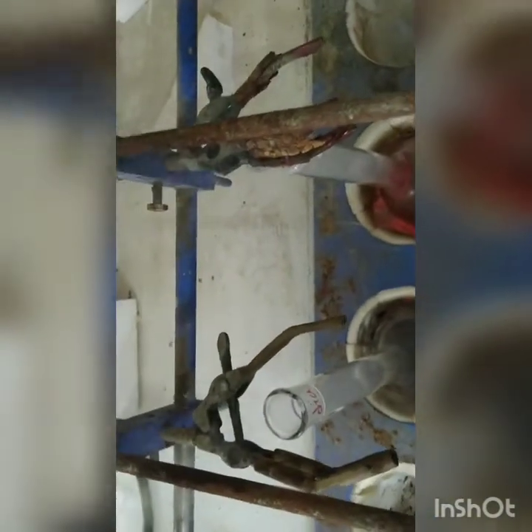color as compared to their earlier color. The samples have got clear color, and you can see the fumes that are coming out. The digestion process is going on. So after about half an hour we are going to keep it for distillation. So the further part we will be doing after say 10-15 minutes.